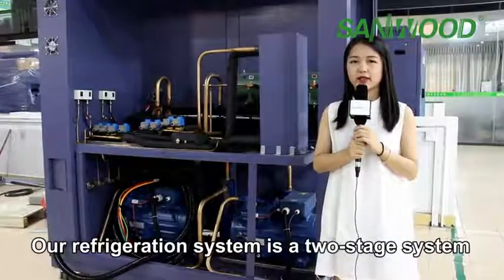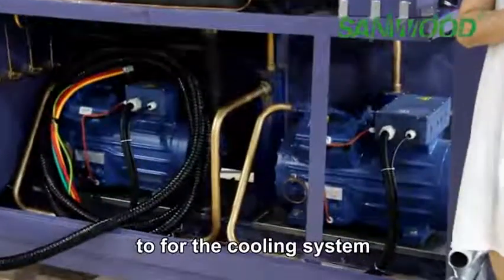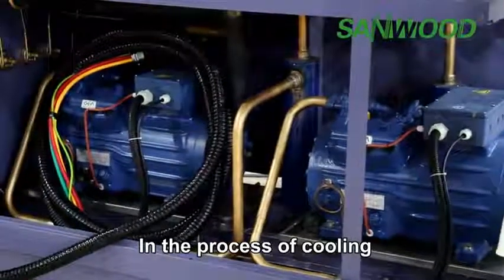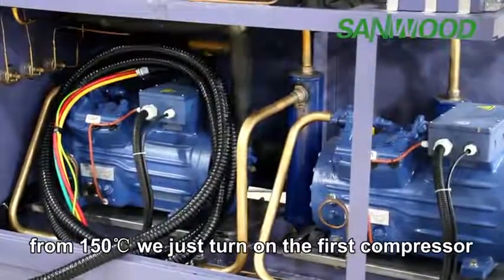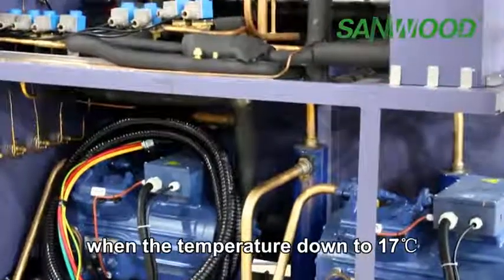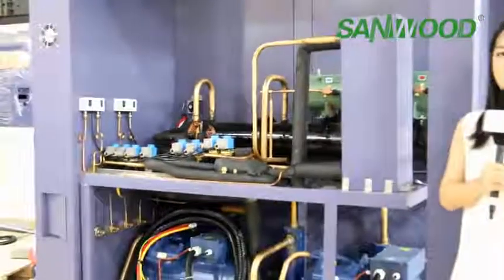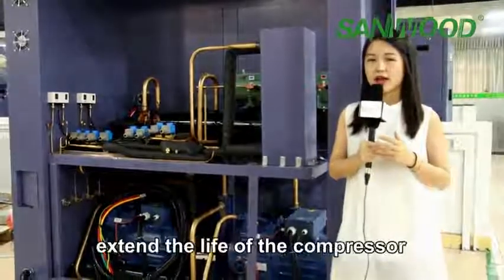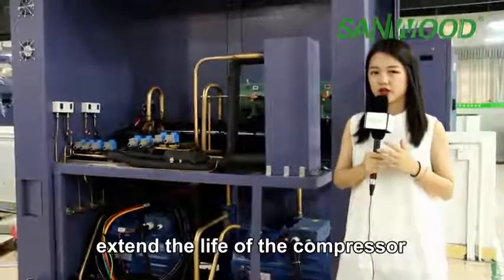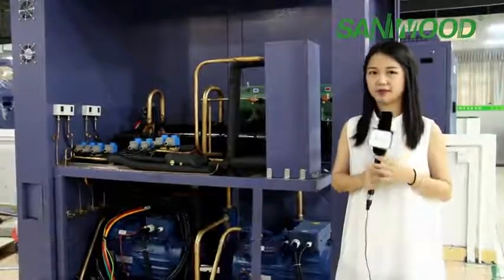Our refrigeration system is a two-stage system. Two-stage means that we use 2 compressors for the cooling system. In the process of cooling, from 150 degrees, we open the first compressor, and when the temperature goes down to 17, we open the second compressor. In this way, we can not only save energy and extend the life of the compressor, but also guarantee the cooling rate.